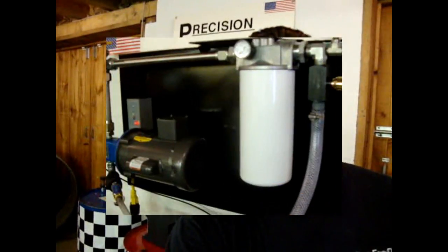Hey, welcome back. Today we're going to do a test utilizing one of our spin-on filter units. We'll be filtering some ultra-low sulfur diesel, coming up with a specification for a customer who wants to be able to deliver a higher quality fuel to their end-user customer.